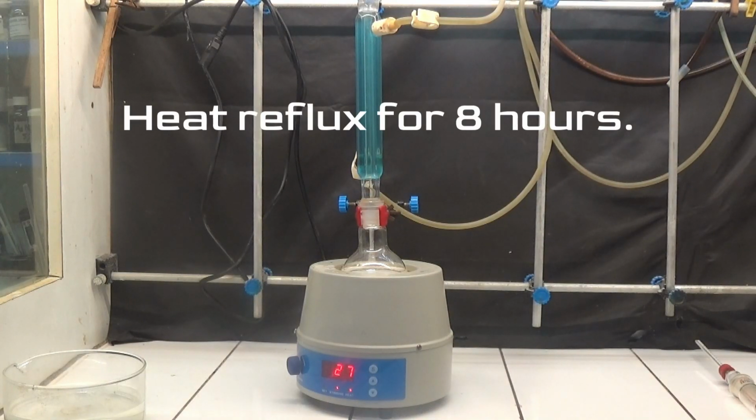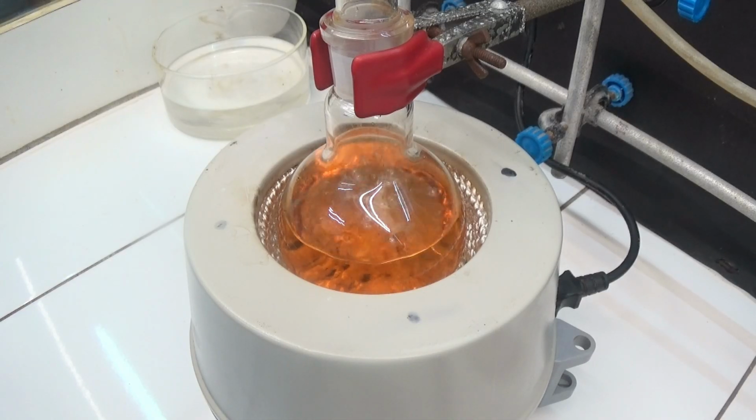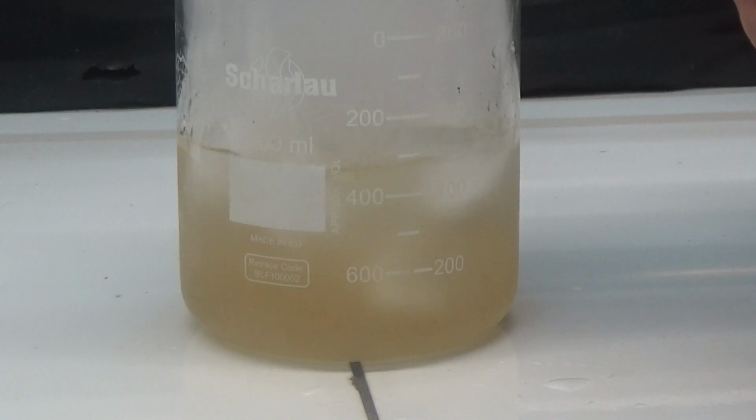Heat the solution under reflux for 8 hours. After 8 hours of refluxing, without allowing to cool, pour the contents into 350 milliliters of ice water.